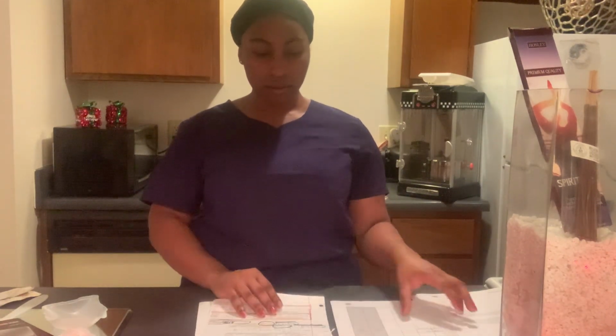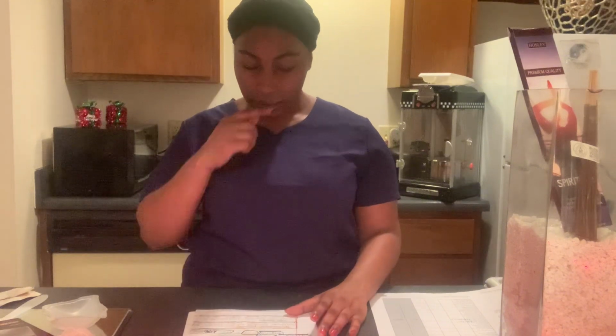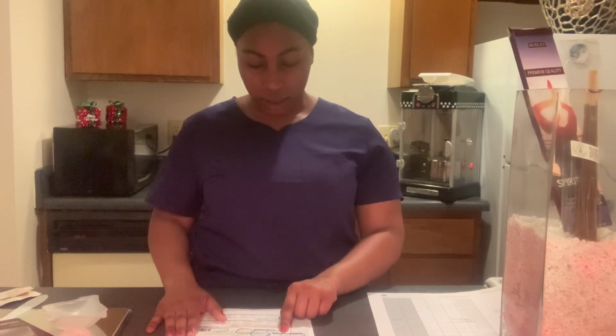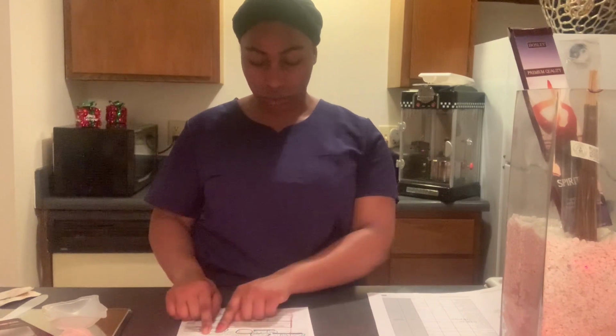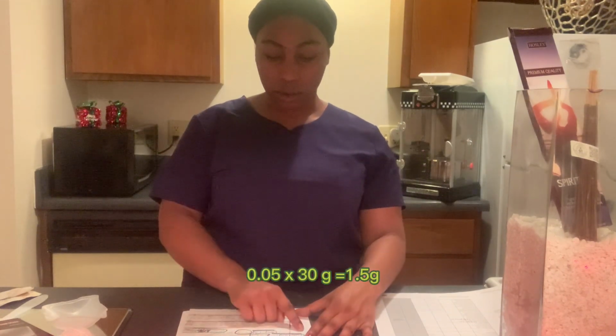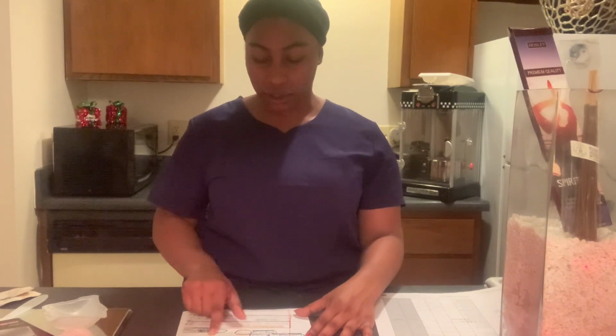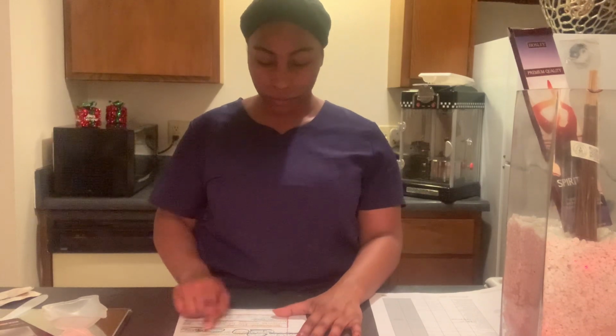With our calculations, 0.05 times 30 grams is equal to 1.5 grams of testosterone powder. So that's what we're going to need, 1.5 grams of testosterone powder.